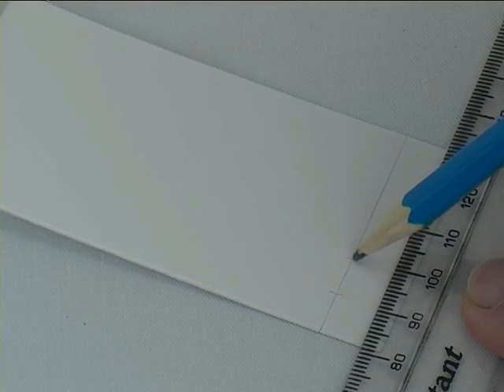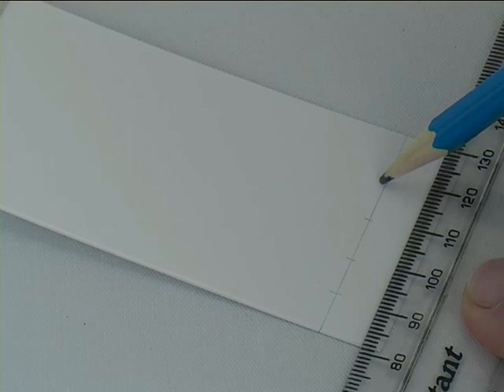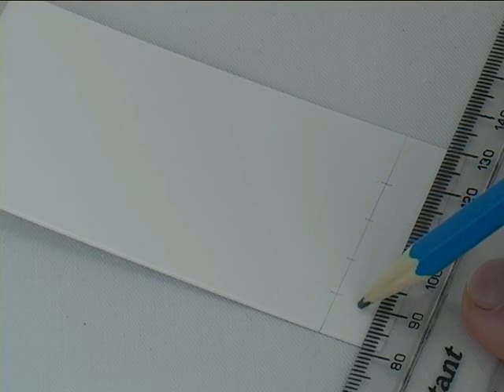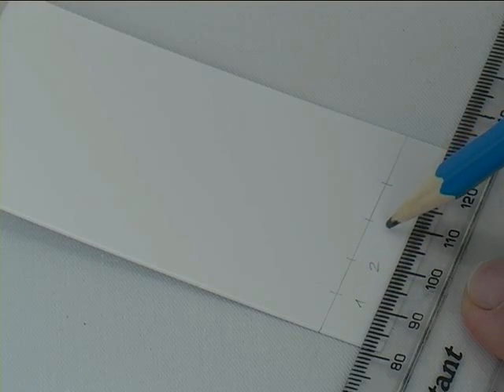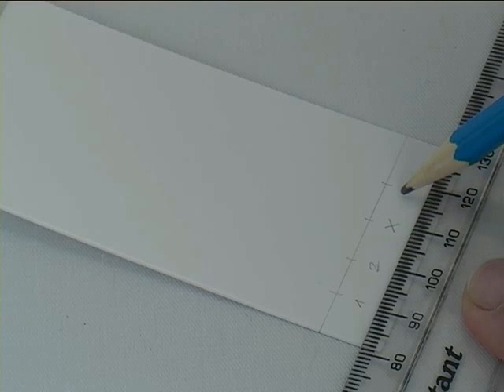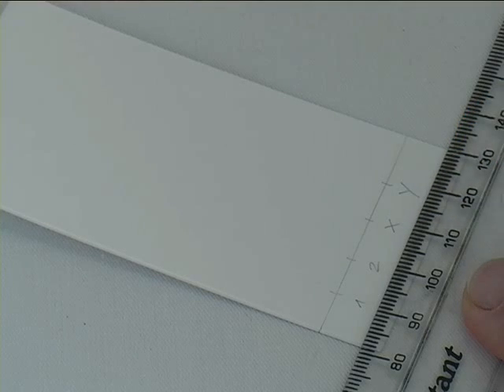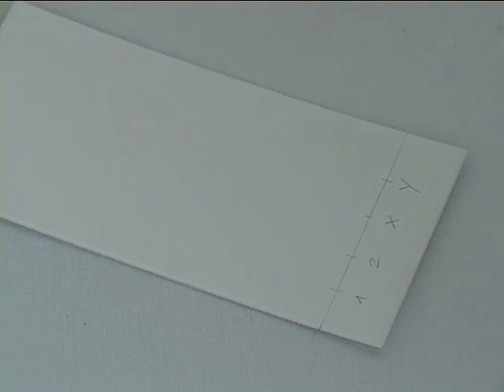After I've drawn the line, I will mark the spots where I want to spot different substances, and I'll give that different names that are arbitrary on this picture, but that will make more sense when you do an experiment, and you can choose them accordingly.